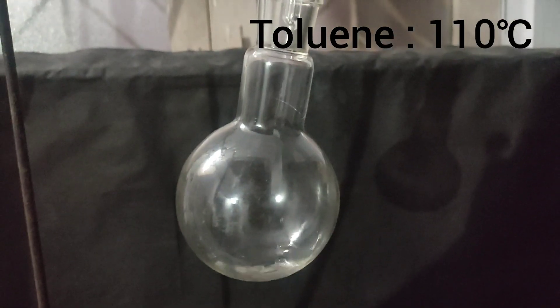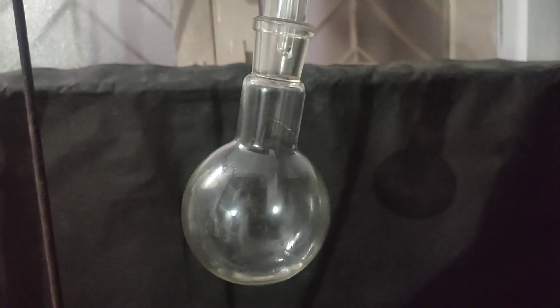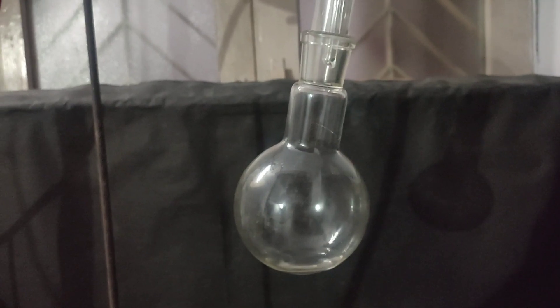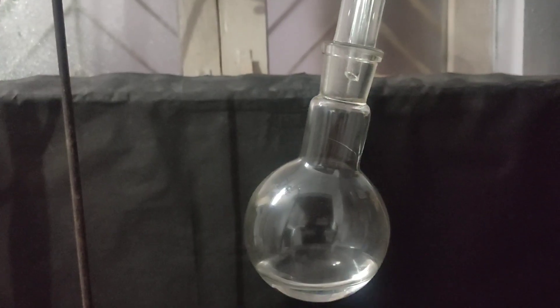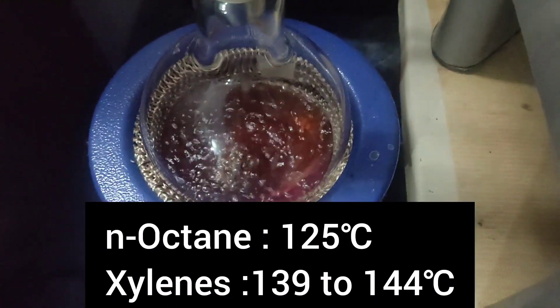And collected everything in a round bottom flask around 110 degree celsius. When the temperature started rising too much, I switched off the heating mantle.